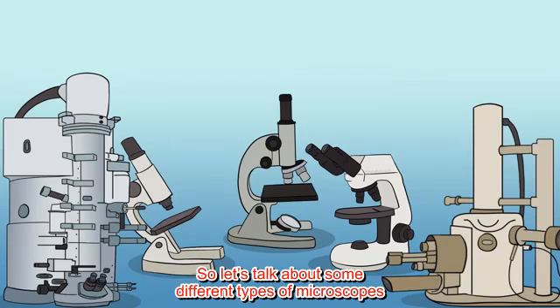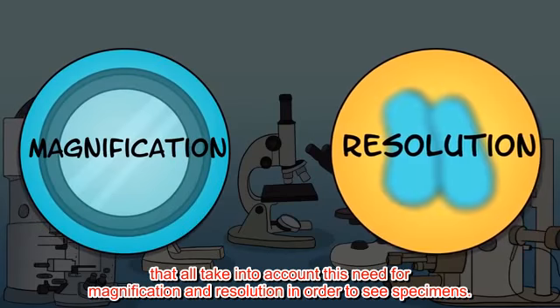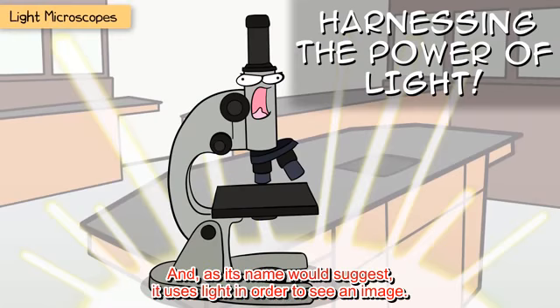So let's talk about some different types of microscopes that all take into account this need for magnification and resolution in order to see specimens. First, light microscopes. If you're in a classroom, this is likely what you have. And as its name would suggest, it uses light in order to see an image.